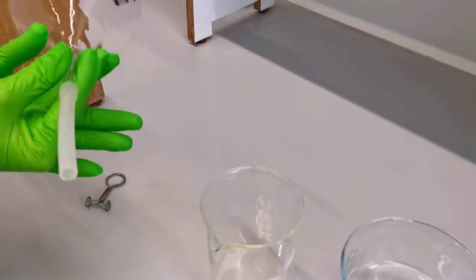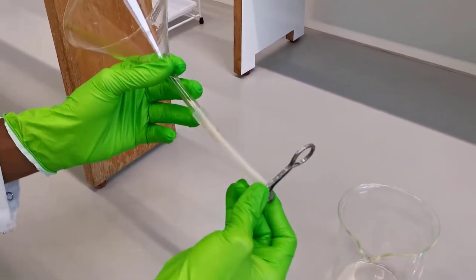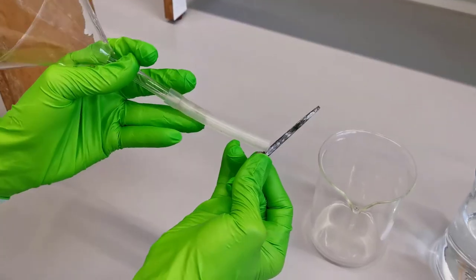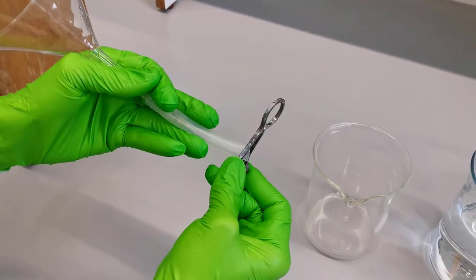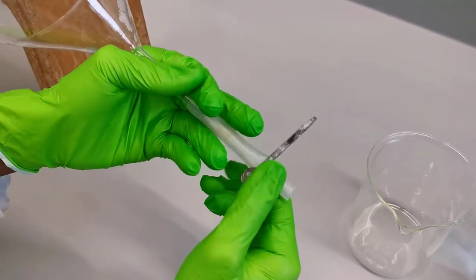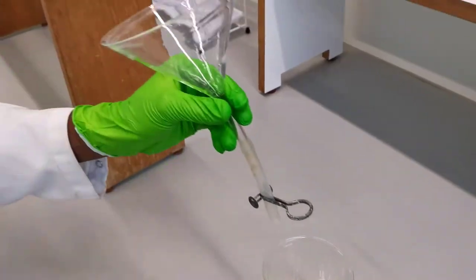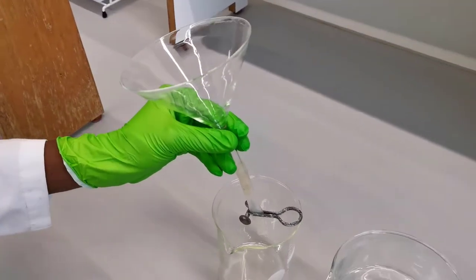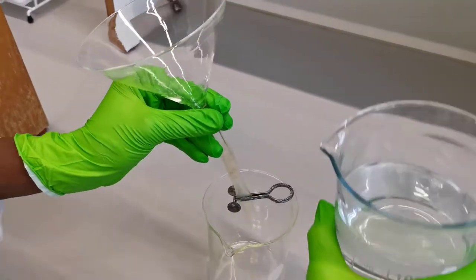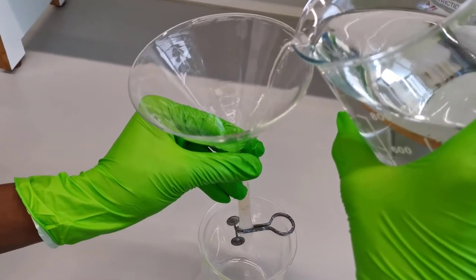To begin with the extraction, one must first check if the clamp can completely block water from the funnel from leaking. This is an important consideration that we must be careful with. We must make absolutely sure water does not leak or drip from the rubber tube. Sometimes if there is a leakage of water, it is good to replace the clamp with a new one that blocks the water completely.